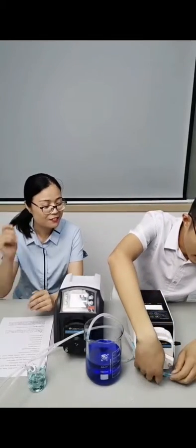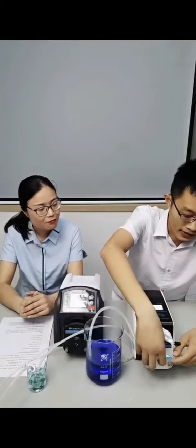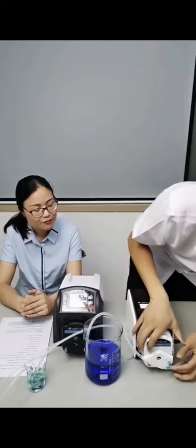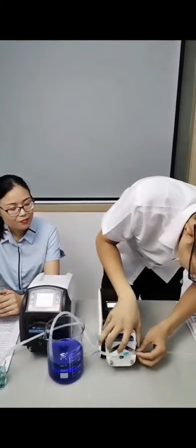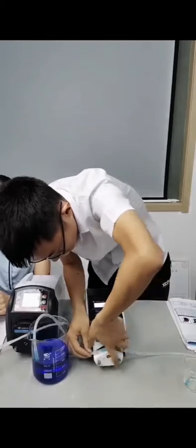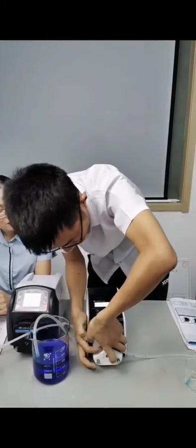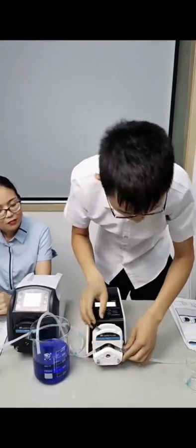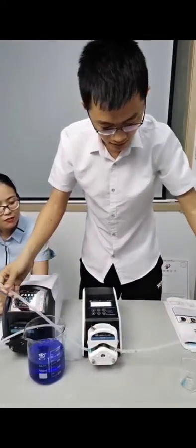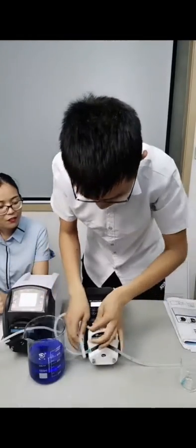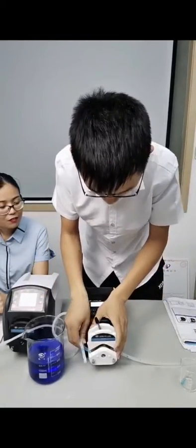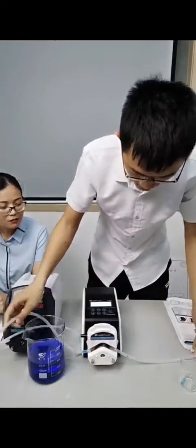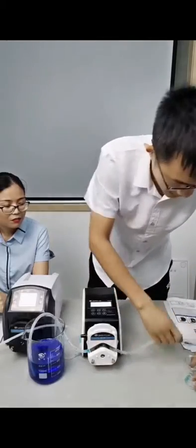First of all, we can install the tube on the pump head. The pump head is very tough, showing good quality. Make sure your tube is in the middle of the pump head. You can adjust the tube in the right way and load it on. So we finish loading the tube on the pump head.